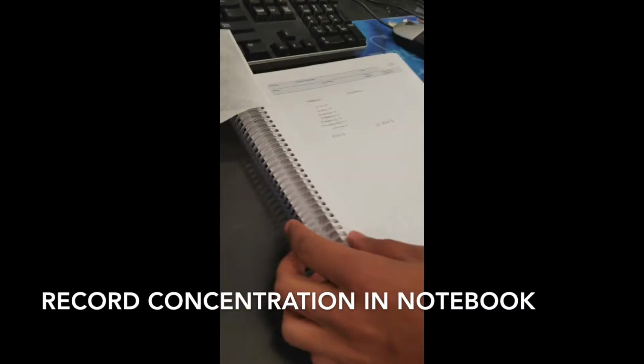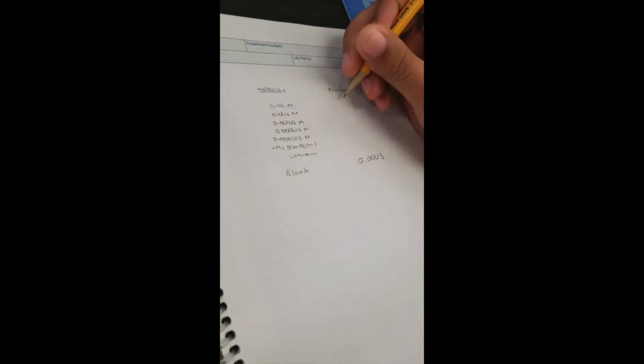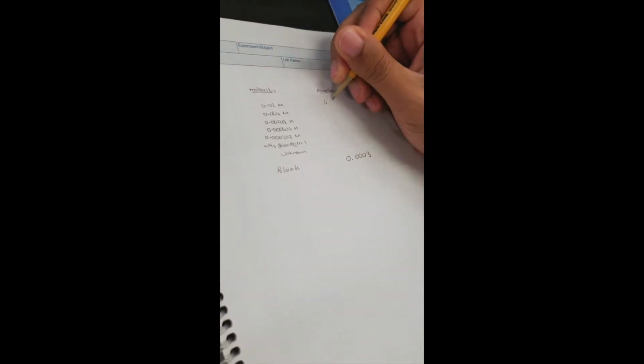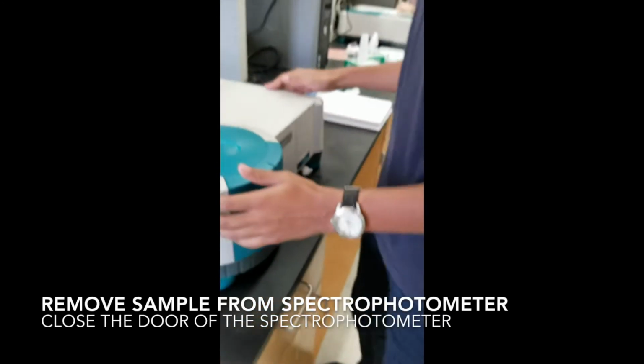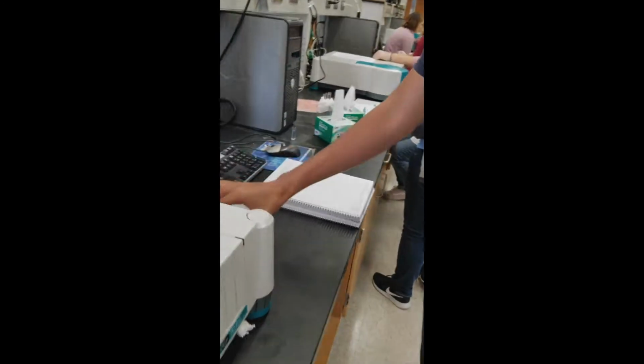So we're going to record it in the notebook. Now this is the stock solution, so it's going to be 0.02 moles. That's the concentration. So absorbance is 0.8480. We're going to take this out. So I'm going to open the door. Carefully remove the cuvette. Close it. And put it down.